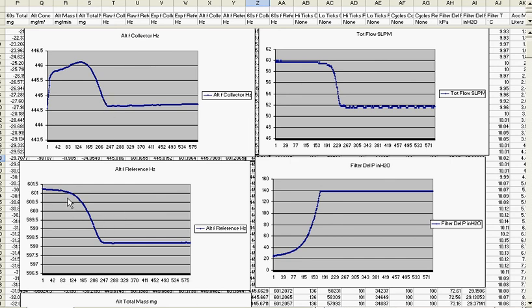And so this is the frequency. I didn't bother showing the mass, but here we show also that this one, the total flow, because the pressure exceeded the total pressure of the BG3 at 140 inches of water, that it decreased the flow. So this is just kind of showing what the worst case is, which has been cured with a new design. So that's why I gave you these two files.